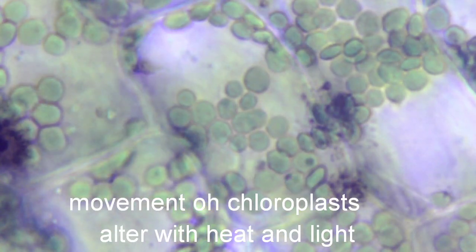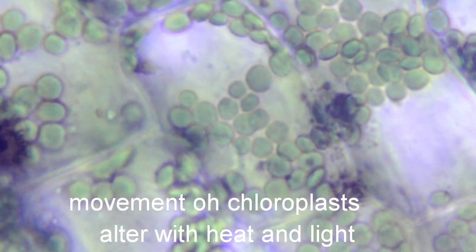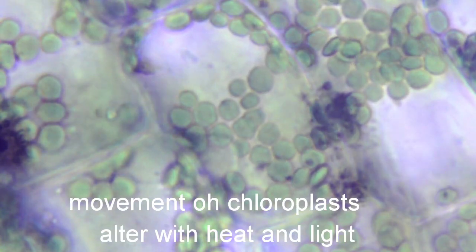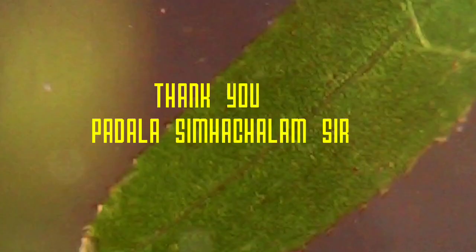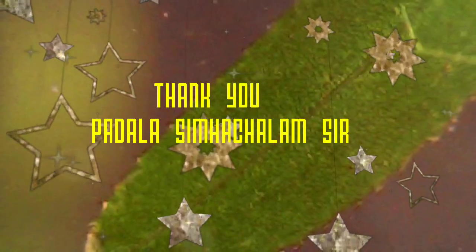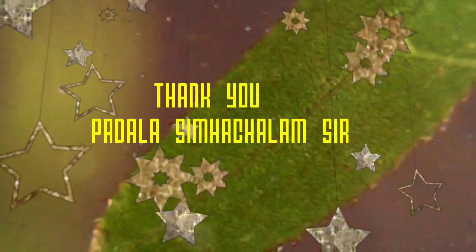The movement of chloroplasts alters with heat and light. Moving chloroplasts in the cells, and the cells are in the leaf — what a wonder!